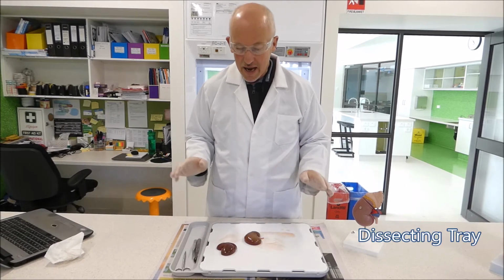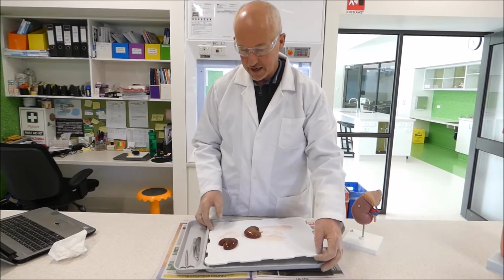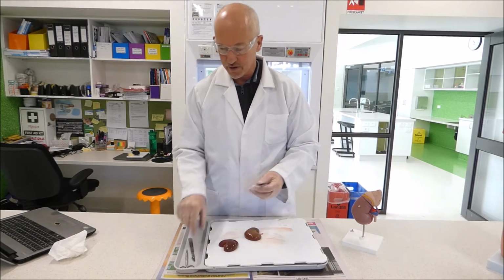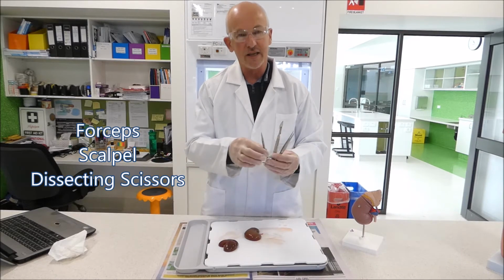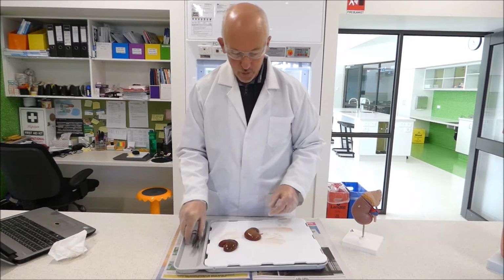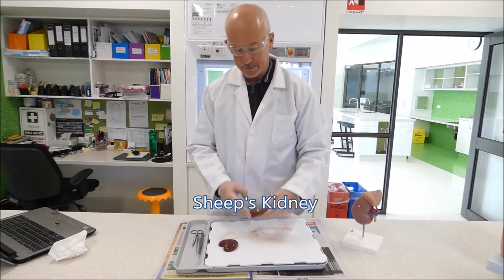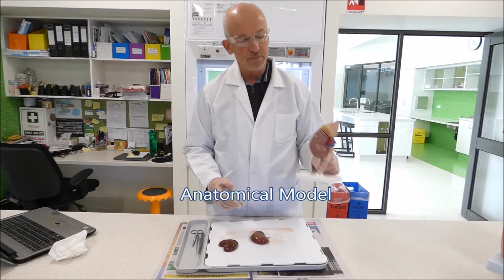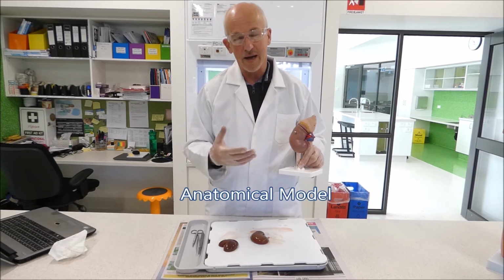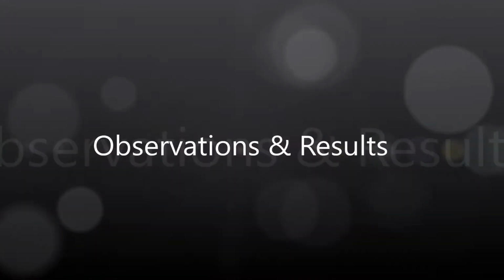Other than that, we're going to have a dissecting tray and a set of dissecting instruments: forceps, a sharp scalpel, and some dissecting scissors. Of course, we're going to need our specimen, a sheep's kidney to dissect, which we get from the butchers. And we'll also have a model here to be able to show some of the parts more clearly to help explain what we're looking at.